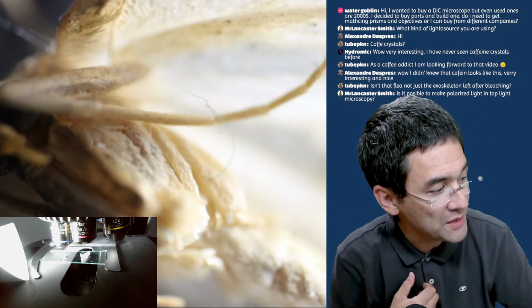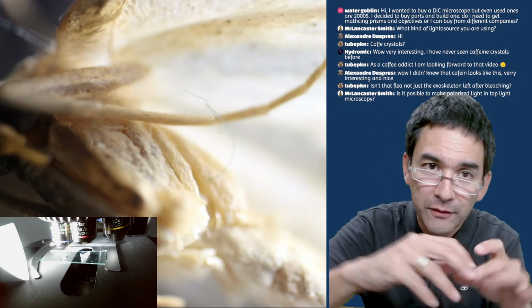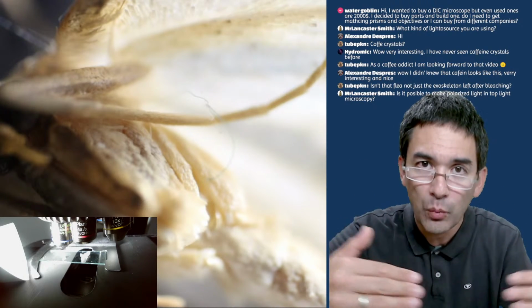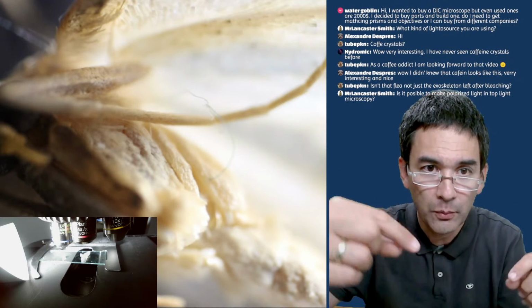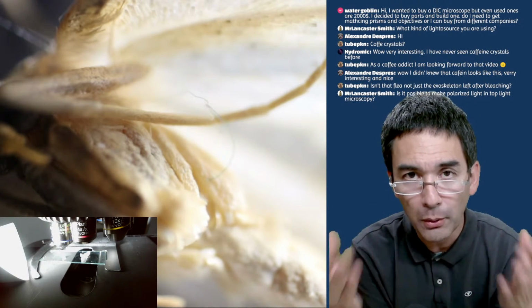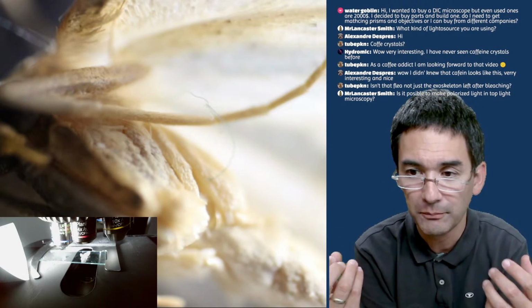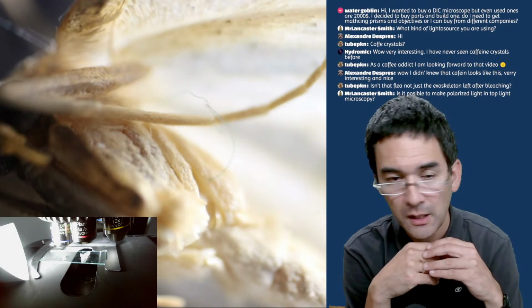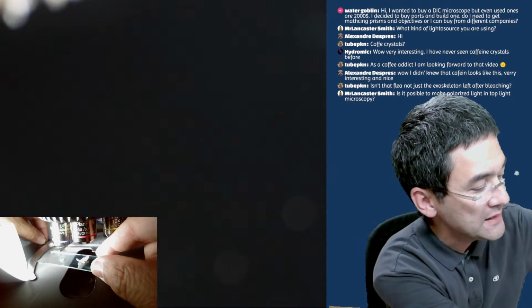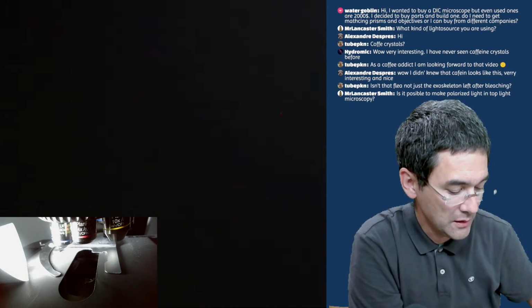Many objects, like this insect over here, are opaque, so it kind of diffuses the light. The light is not reflected in the same way as in a non-metallic reflection; when the light bounces off, it's kind of depolarized. So I think that if you shine polarized light on an object, you won't really get an effect. That's my assumption. So again, you have to use an object that reflects the light in a polarized, non-metallic way, and then probably you're going to see an effect.